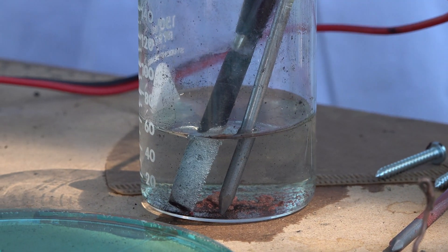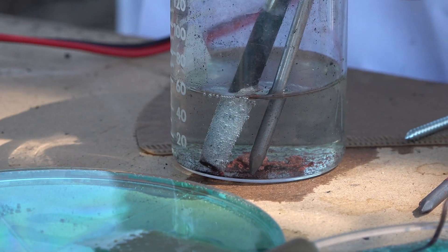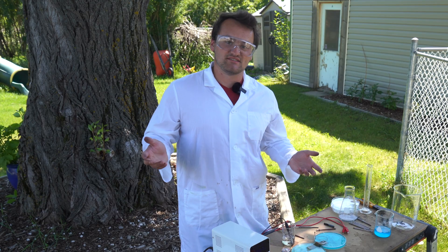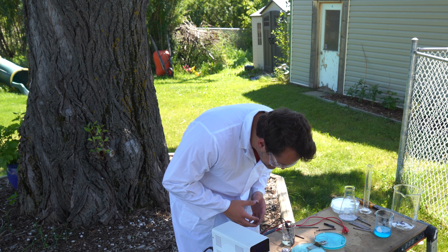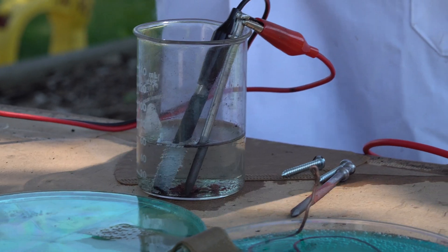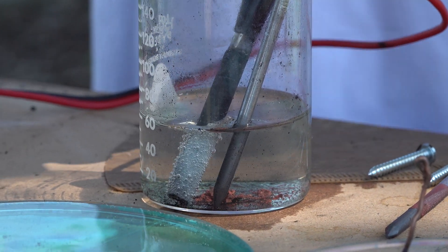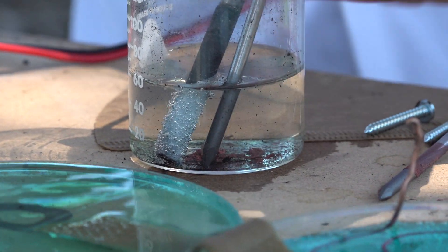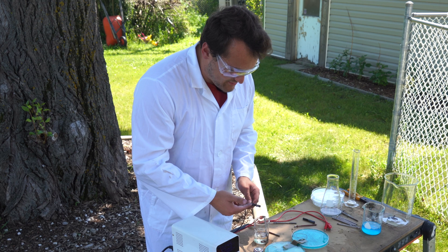What we're doing here is reversing the oxidation of zinc — we're reducing our zinc ions into zinc metal, and we are oxidizing oxide ions into oxygen. However, something unexpected has happened. We've now pulled enough zinc out of solution onto the carbon rod that we are preferentially reducing hydrogen ions into hydrogen gas instead. So we have hydrogen coming out of solution on the zinc, and we should have oxygen coming out on the iron. Basically, we've covered our carbon rod in enough zinc that it's now starting to act like a zinc electrode.